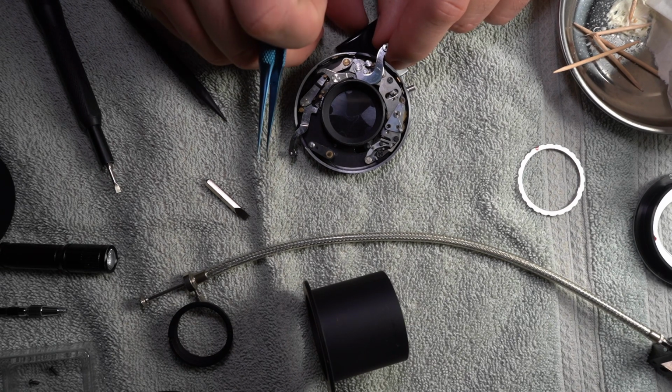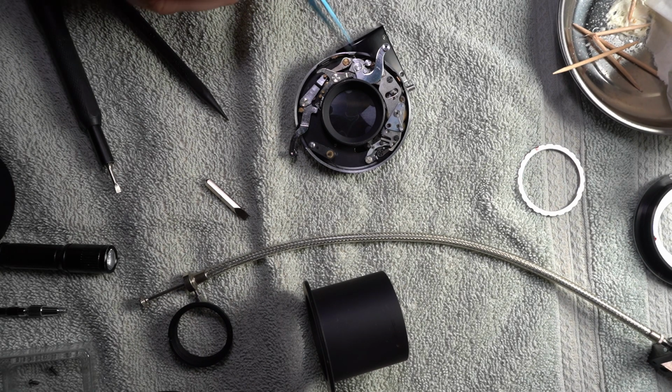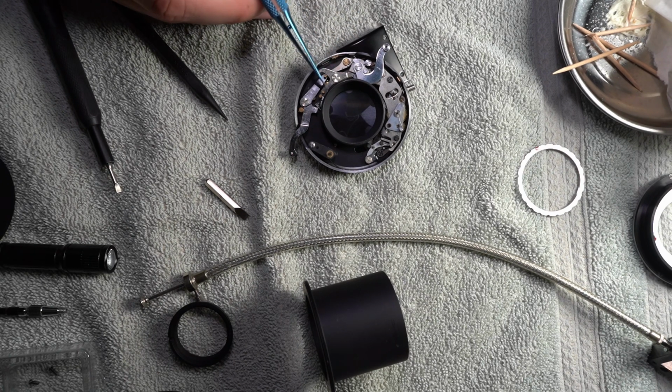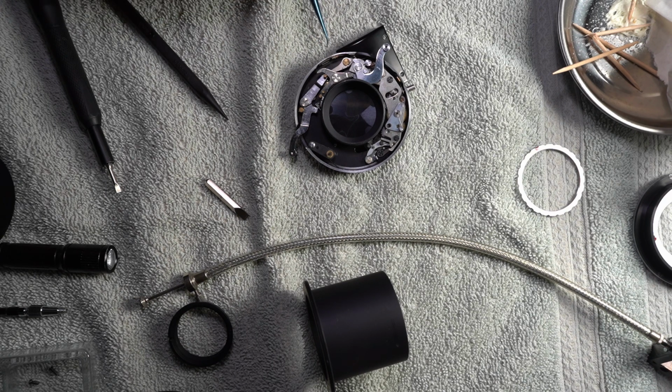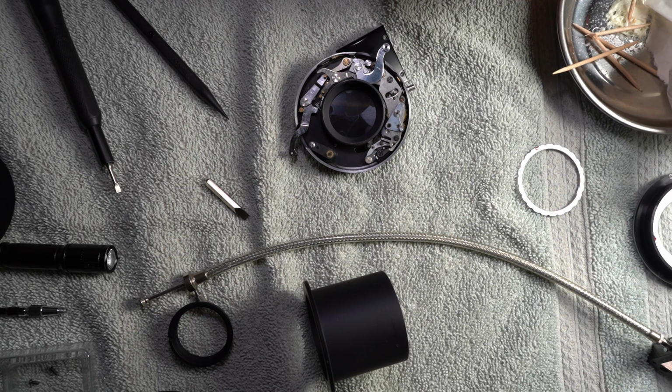Let me get this propped up here for you. And then bring the light up. I'm trying to make this so you can actually see it. And I know there's overexposed spots, but I can't help that. Anyway, so this arm here, it pivots here, and then there's a little divot here, or like a step down. And over on this face, right across the middle of it, you can kind of see some grease there. Or oil or something. I think it's grease now. It probably used to be oil.